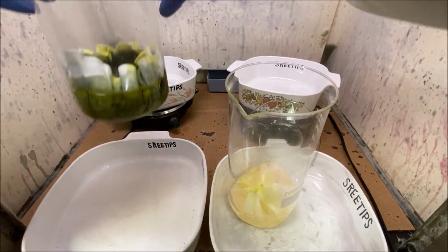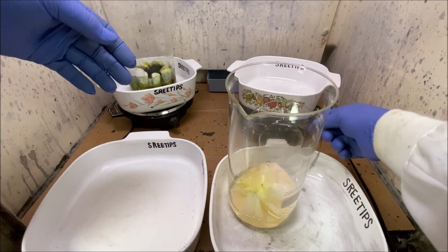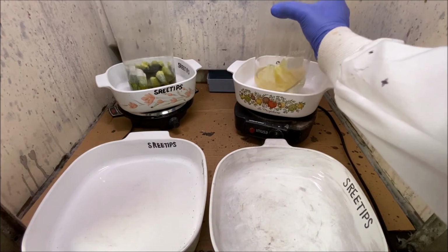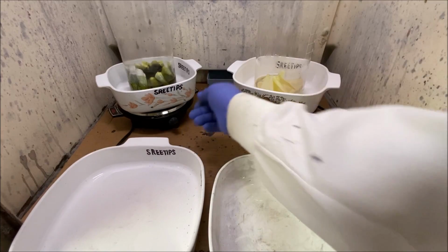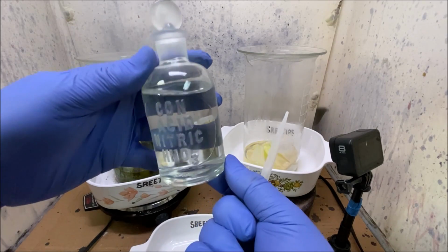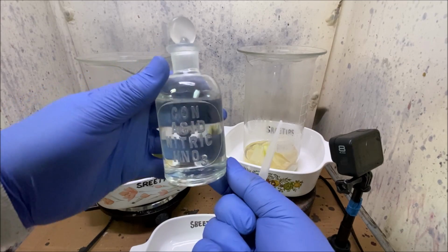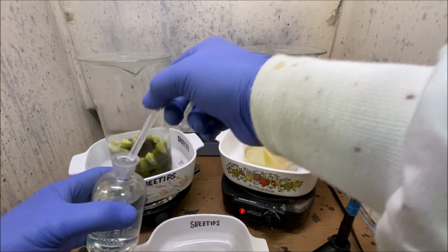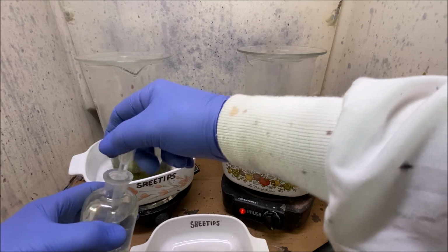I rinsed as much of the silver out of here as I could, but there's still going to be some silver in there. There's no way to get it out 100%. And we're going to add some heat to both of these. We're going to start adding small doses of nitric acid to each one of these. This is going to form aqua regia inside these beakers when it hits the hydrochloric acid and start dissolving the metals for us.